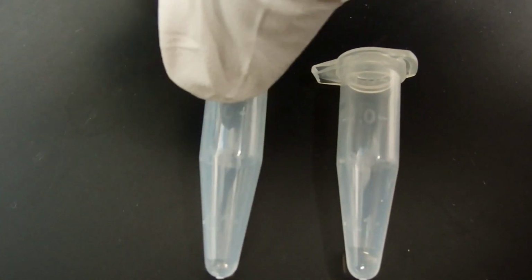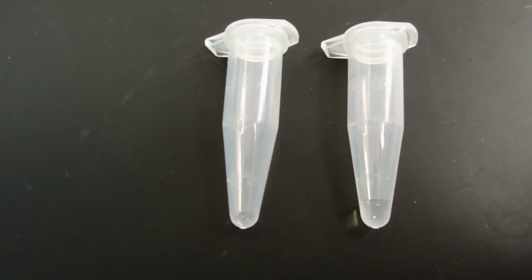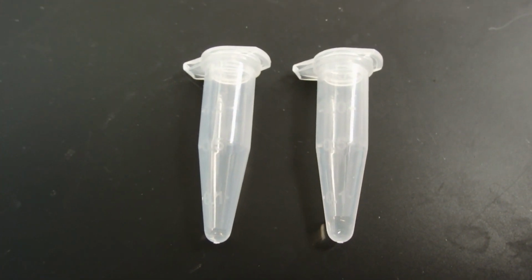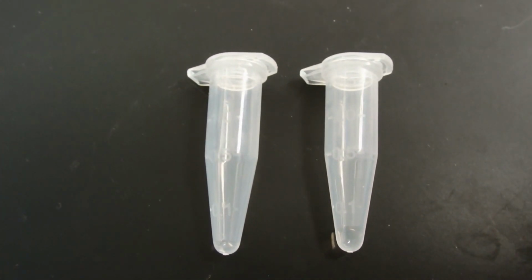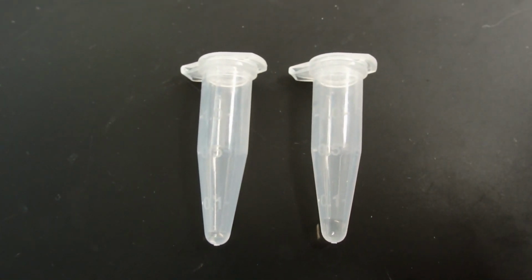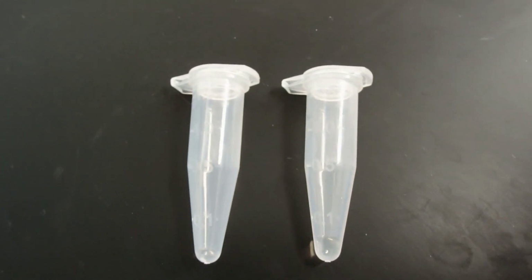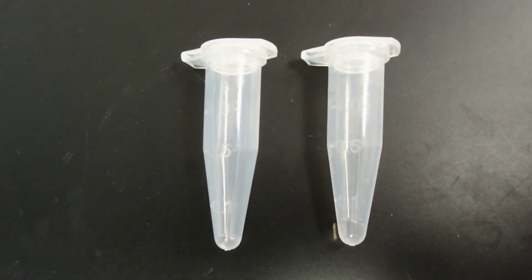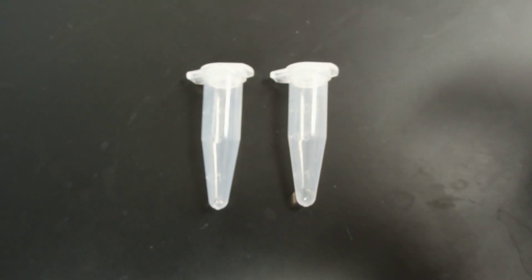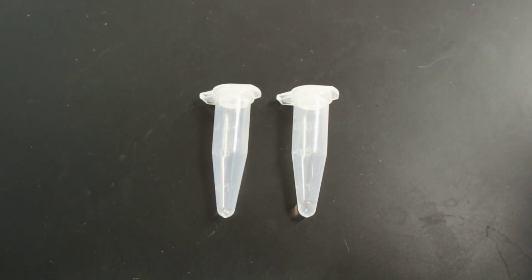Of course, the bigger gel fragment resulted in more volume, obviously. An important consideration is basically the more precisely you cut your band out, the higher the DNA concentration will be in that tube. And since you often set up a ligation of just a total of five microliters and maybe only use half a microliter to one microliter in here, it's desirable to cut your gel very precisely so that this DNA is ready to go into a ligation.